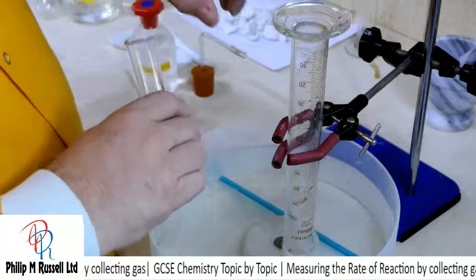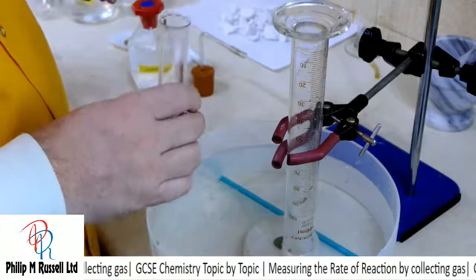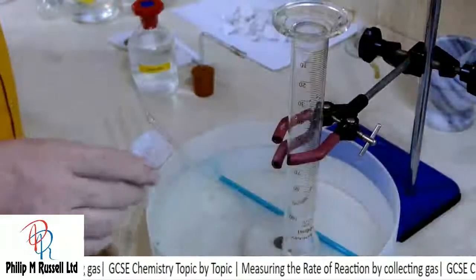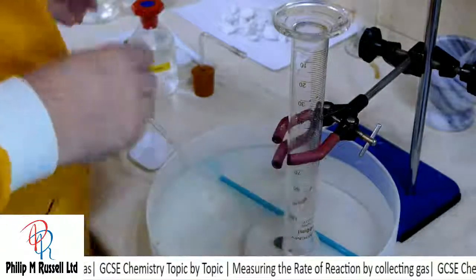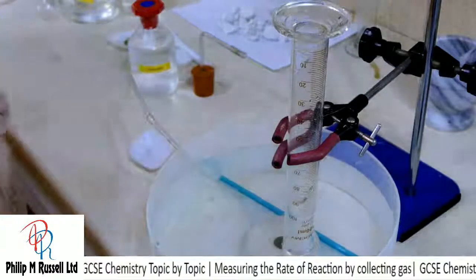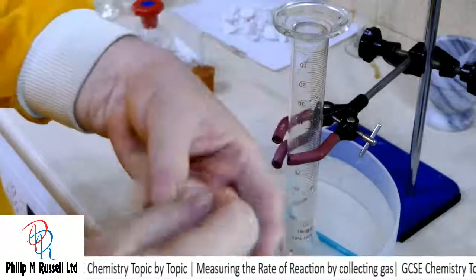What I would need to do, however, to show that's lime water and carbon dioxide, would be to try and be a bit more crafty in doing this experiment. And I'm going to try it and see if I can have a bit of luck.